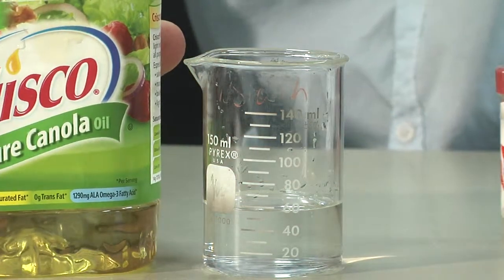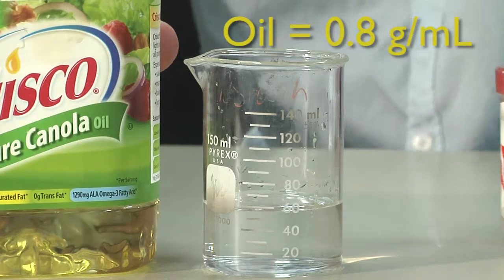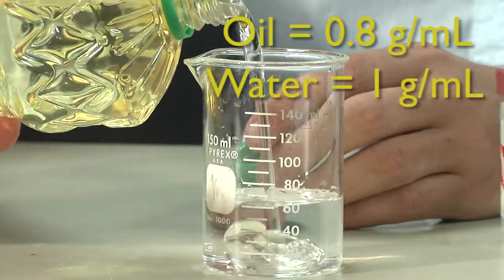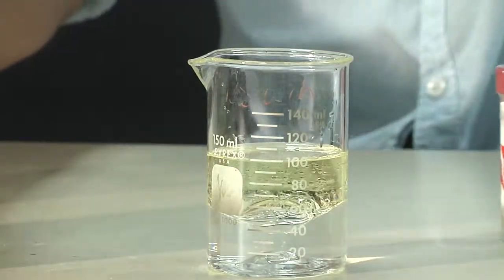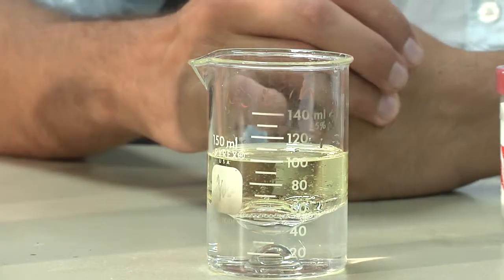Similarly, we can use density to separate petroleum or oil from water. So oil typically has a density of somewhere in the range of 0.8 grams per milliliter, whereas water has 1 gram per milliliter. Which one do you think will be on top? Well, here we see that the oil is on top because it is less dense than water, which is on the bottom.